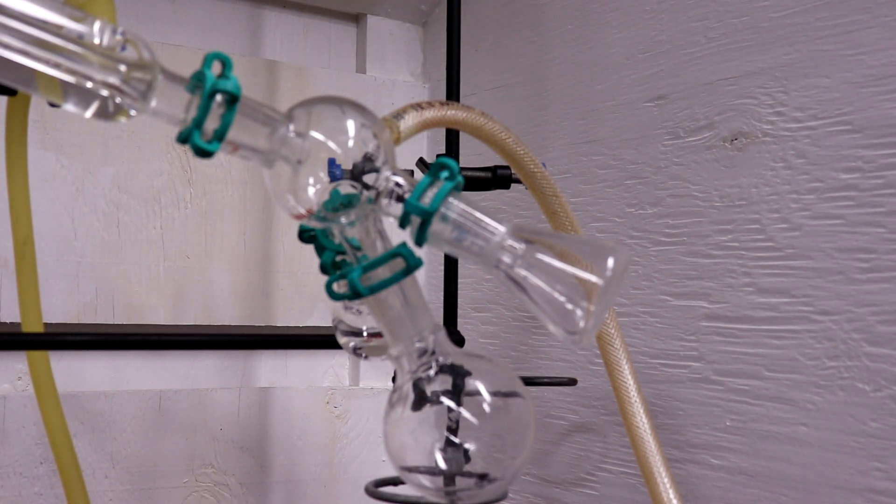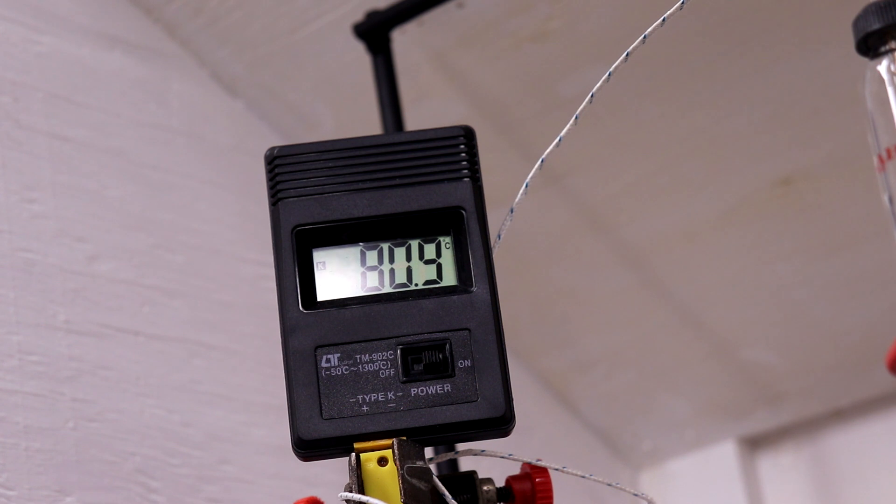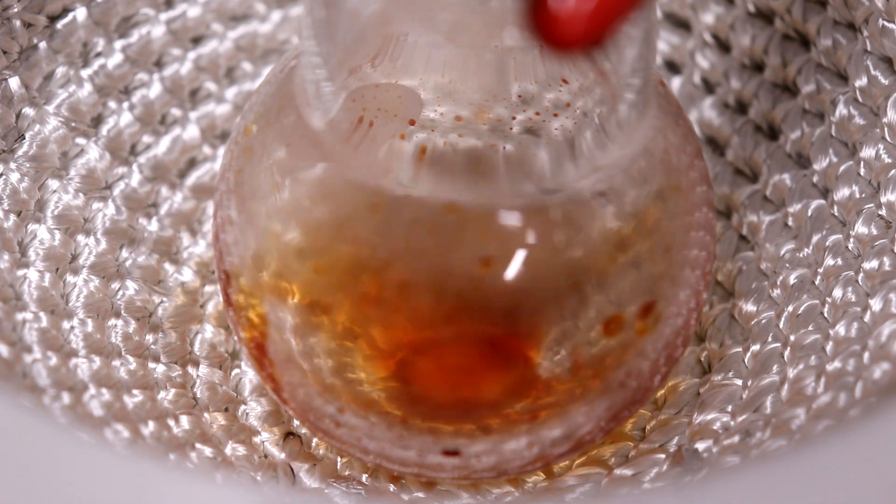I wasn't certain whether this was due to the slow compositional change of the vapor, or due to the loss of vacuum in the system. As I didn't have a vacuum gauge at the time, I wasn't certain what the pressure in the system was, nor if it was changing over time.